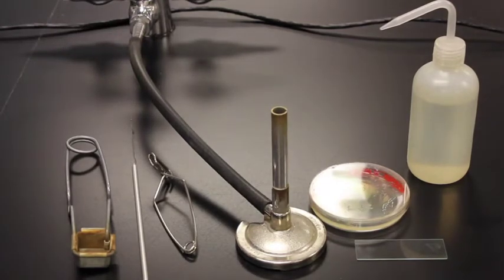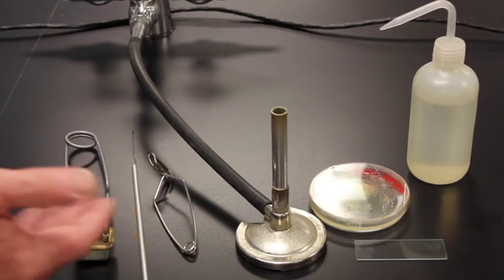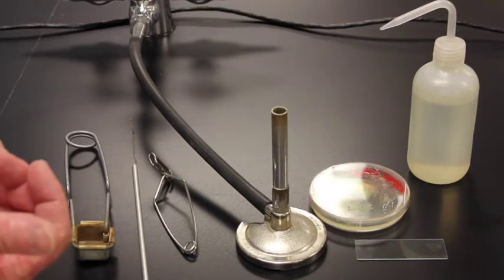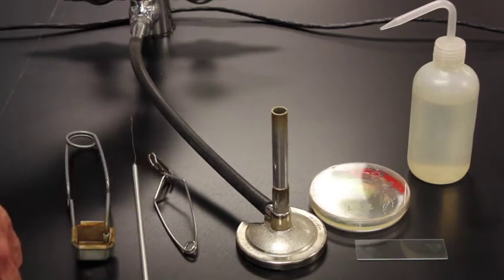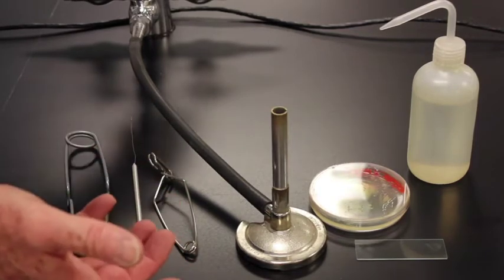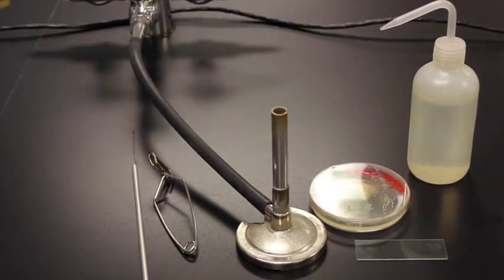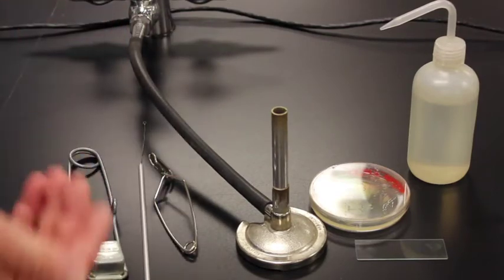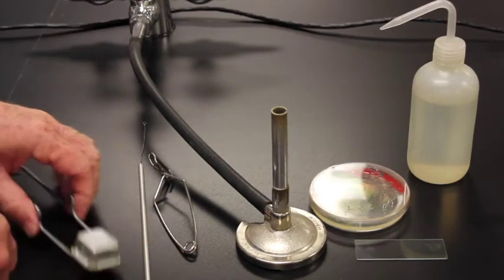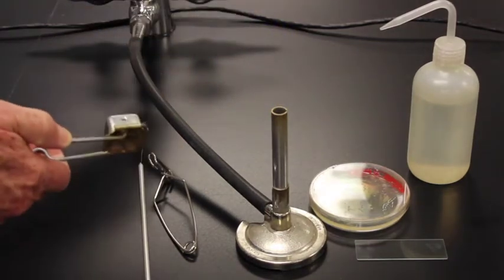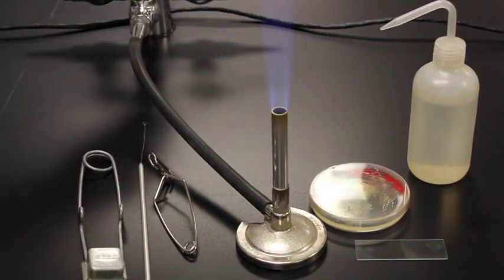Now the first step is going to be lighting the Bunsen burner. When you light Bunsen burners, you want to be safe. Stay away. If you have hair tie back your hair. Make sure that long hair doesn't get near it because hair really goes up in flames quite easily. So the first thing I want to do is I want to turn on the gas. Now this time I'm going to show you what not to do to begin with. So I turn the gas way up and I hear that gas. And if I turn the gas really high, when I try to light the Bunsen burner, it basically goes out all the time. So I don't want to turn it up really high. I want to barely turn it to where I hear it. So I'm going to be quiet here. And I barely hear any of the sound coming out. And I just click on that. A little bit too high. I'm going to turn it down a little bit. Then we can get it if we just barely get that.